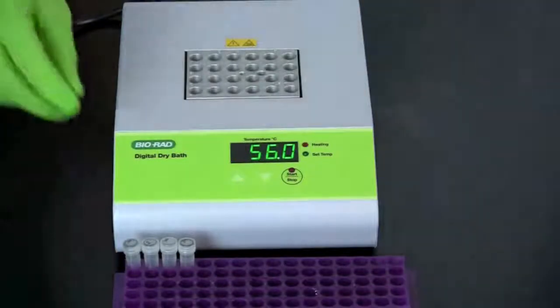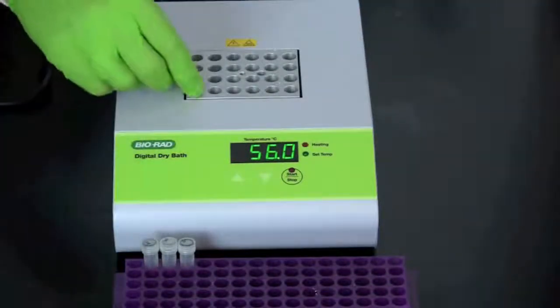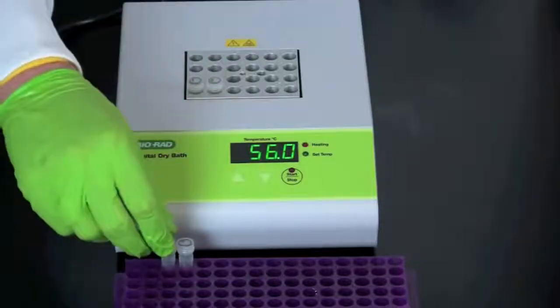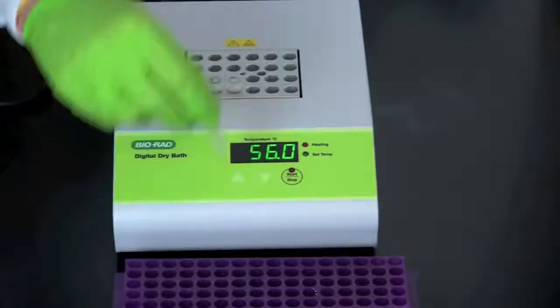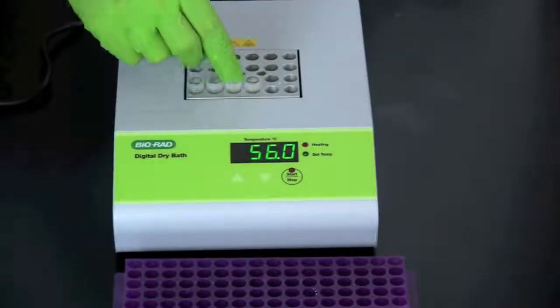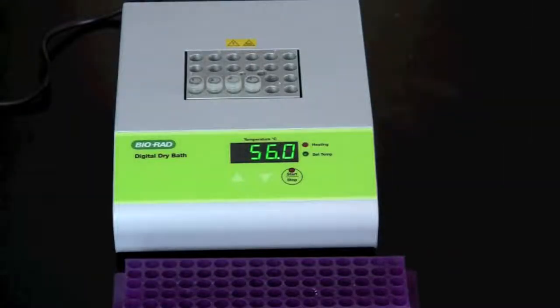Incubate the screw cap tubes at 56 degrees Celsius for 10 minutes. After 5 minutes of the incubation, vortex or shake the tubes and place them back into the 56 degrees for the remaining 5 minutes.